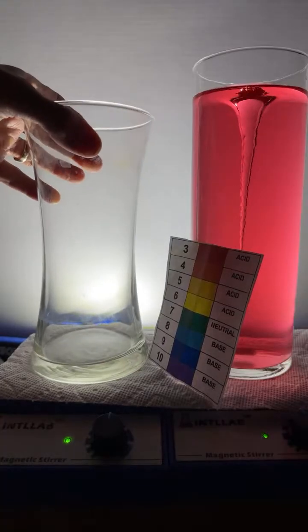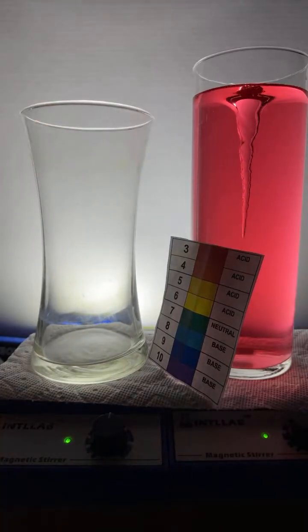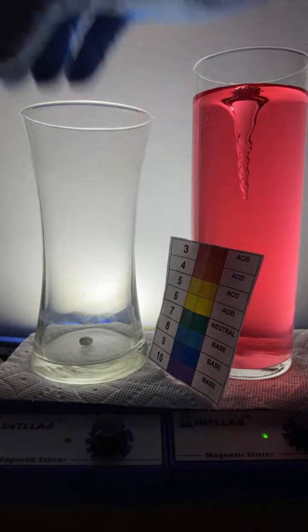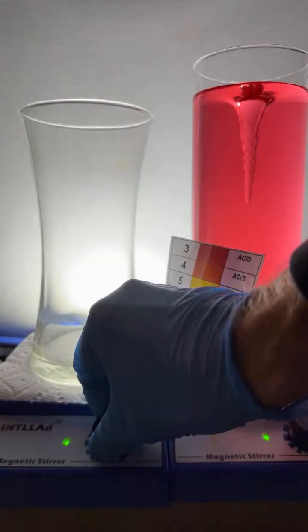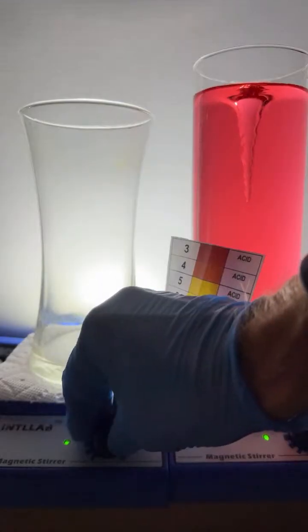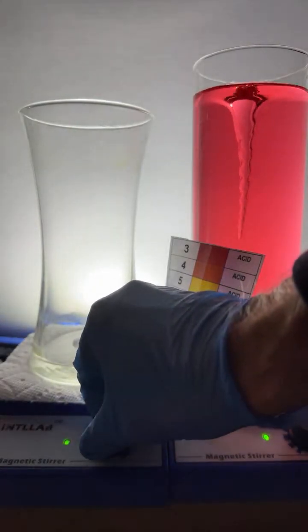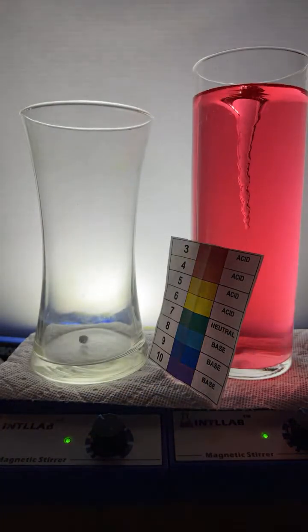I'm going to stick a little flask on here. And to this flask, you know what, let's do it a little differently. This one I'm going to add a really tiny stir bar. That's really small in there. All right, we're going to turn that stir bar on. Woo, that thing's having a hard time. That little one might not work. It might work better if I get some water in there.